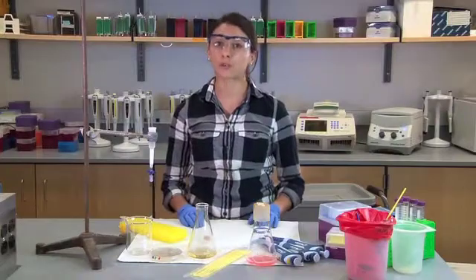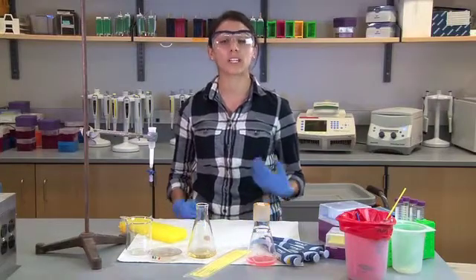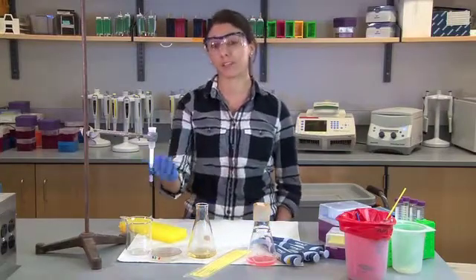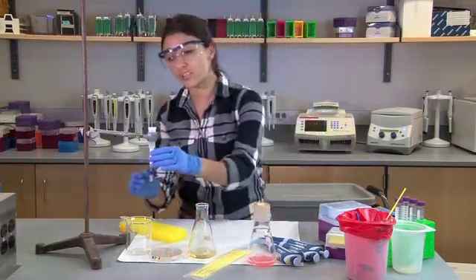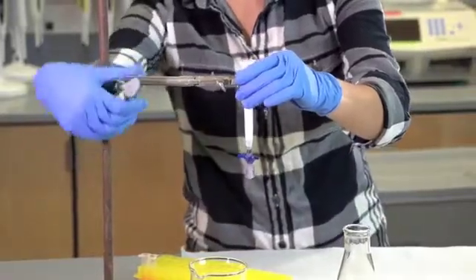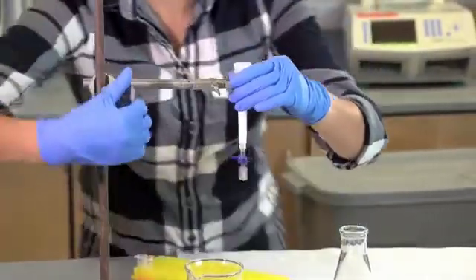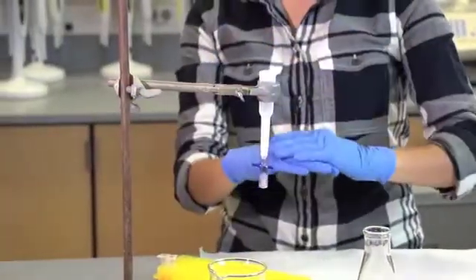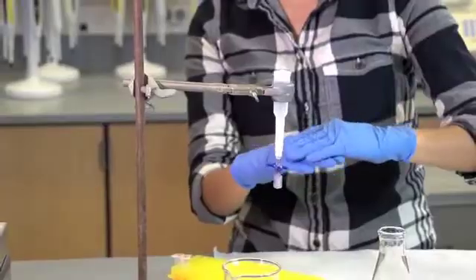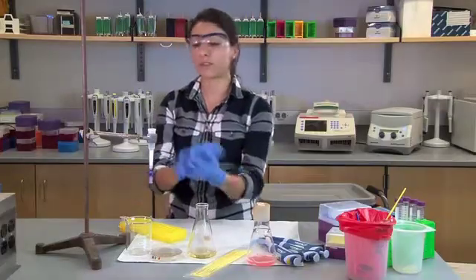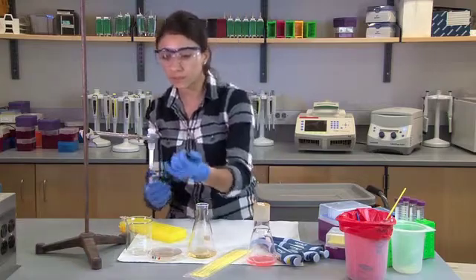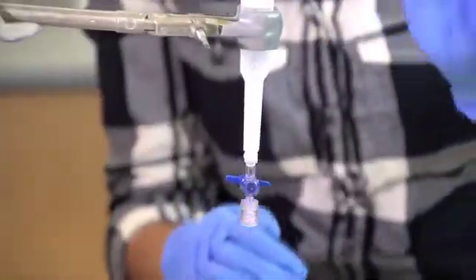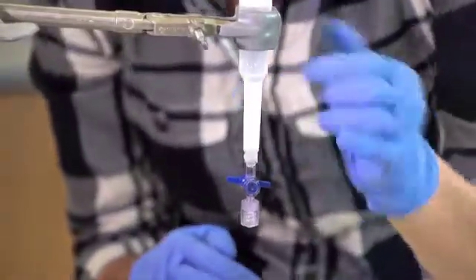The key piece of equipment that you will receive in your kit for laboratory 6 is your column. These guys are super finicky, but the important thing is that you make sure that they don't dry out and that they're upright. So you can see right now that I have my column on a column stand so that the resin beads are completely settled and packed nicely. If we were to tip them over, the beads would then move and that would be horrible for our lab.